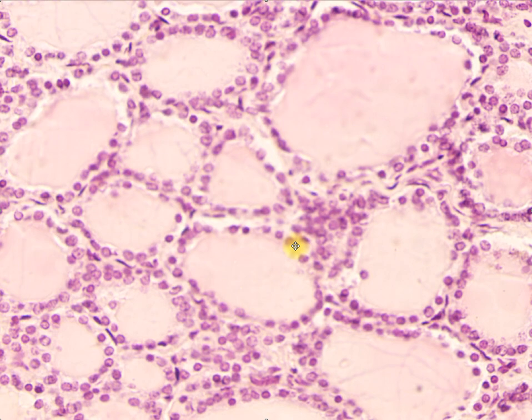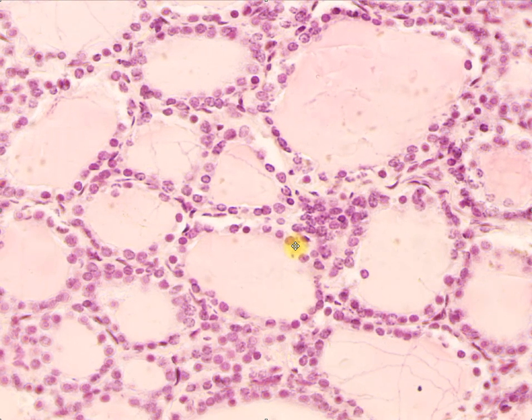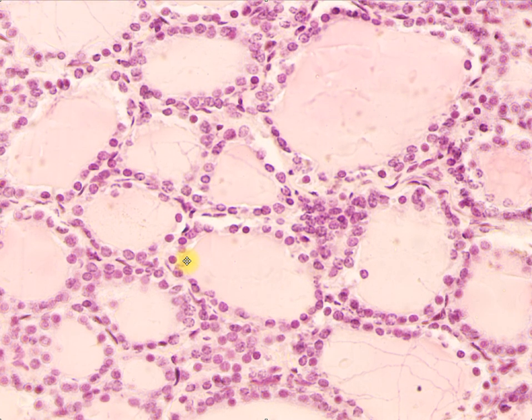So here you can see that we have your thyroid follicles here, here, here, and here. Here are the spaces or the lumen of your thyroid follicular gland. They are secreting something in the lumen here. That means these are your cuboidal cells again with the round nuclei. And this is the apical portion or surface of your cuboidal cells, and that means your basement membrane is somewhere here.